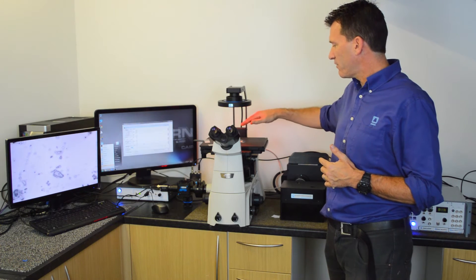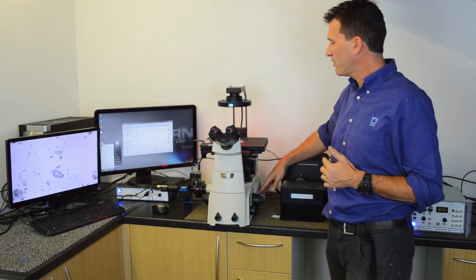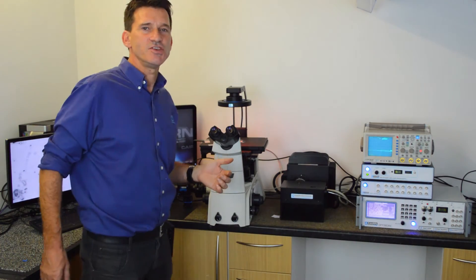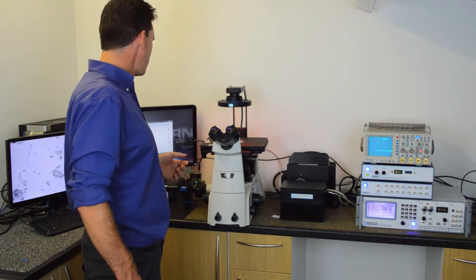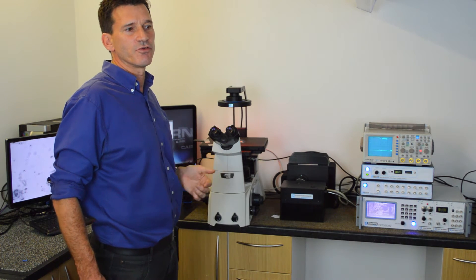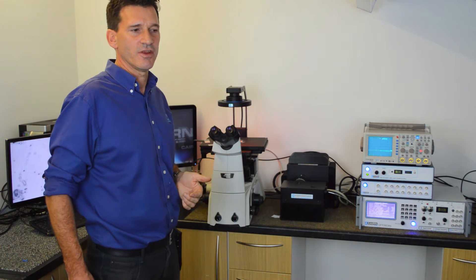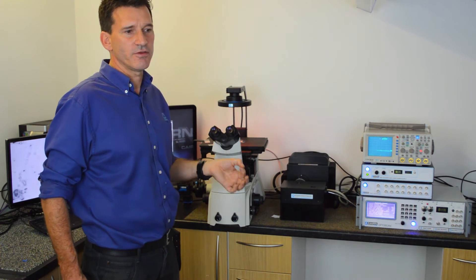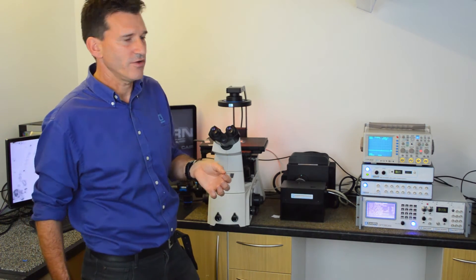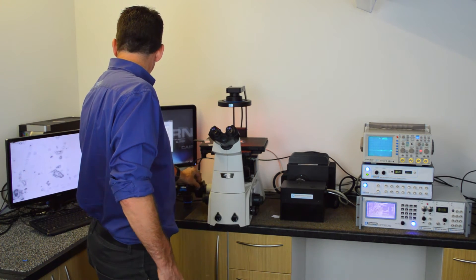The long wavelength of fluorescence passes back through the objective to the side port of the microscope. Unlike imaging where you have spatial information, with a photometry system you're just recording a single spatial point, and instead you're interested in time resolution and very sensitive small changes. So we need to determine where we're recording from.